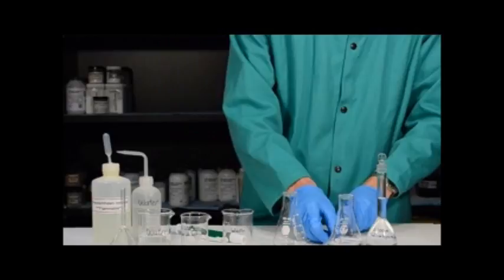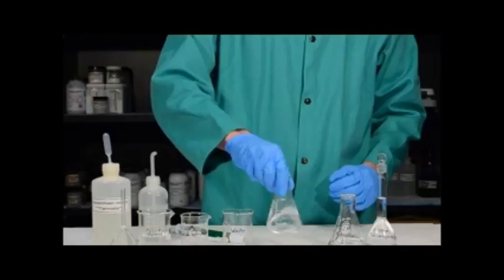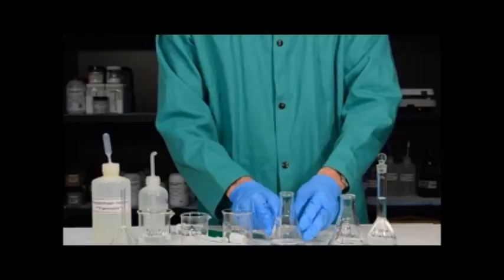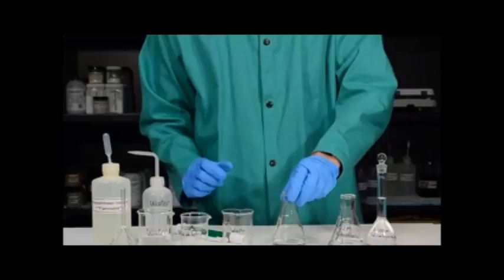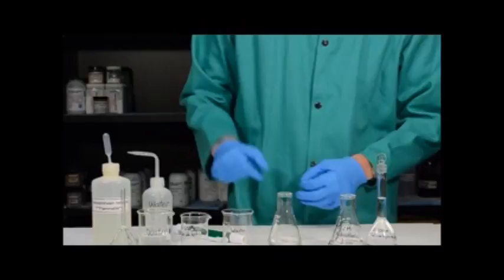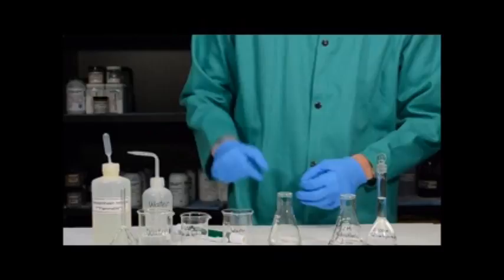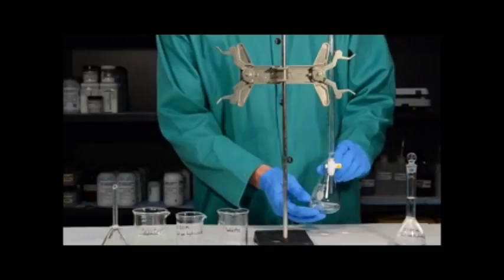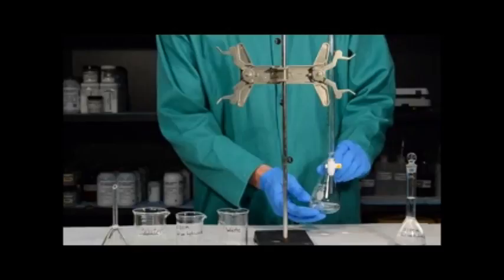Finally, I want to use a squirt bottle of water to swirl down the sides of the Erlenmeyer flask so that all the solution is in the bottom, then swirl the flask. It doesn't matter how much water you add since the water doesn't have any acid in it — a reasonable amount is fine for rinsing, but you should not fill the entire flask. I then want to add a couple drops of phenolphthalein indicator. More is not better with phenolphthalein — one or two drops is plenty.